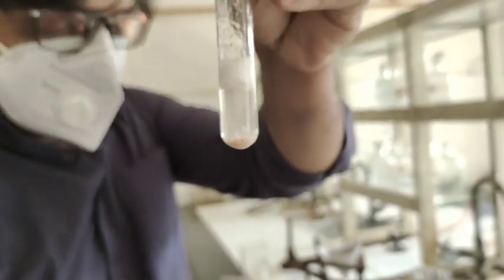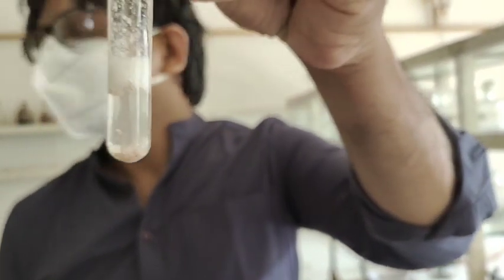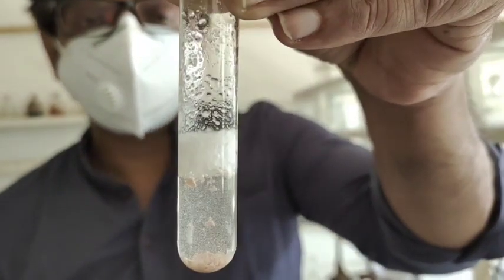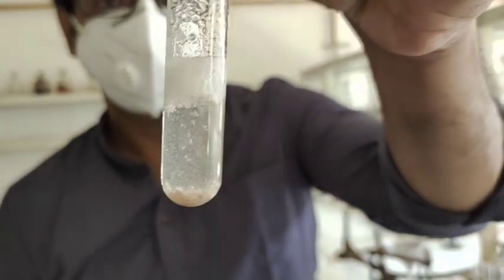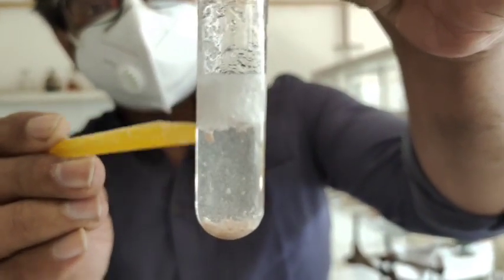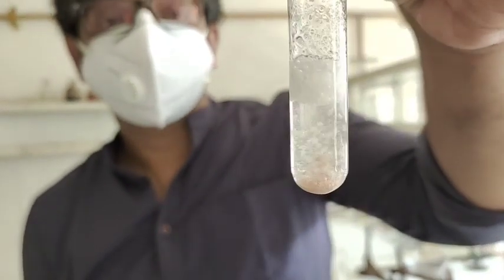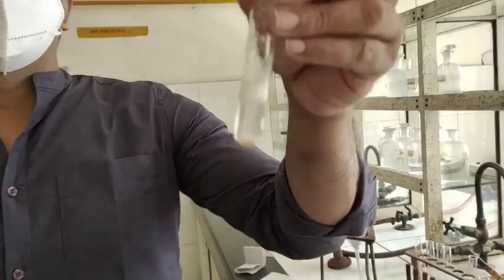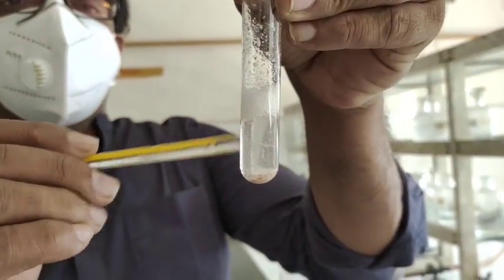Now you see there are two things — please concentrate on this. One is the liquid part and the other is the solid part. The liquid part is the carboxylic acid which has reacted with sodium bicarbonate to form the sodium salt of carboxylic acid. The other part is the other organic compound — that could be phenol, base, neutral, whatever. Because this is a salt, this is a water-soluble salt. This solid part is known as residue, and the liquid part is known as filtrate.